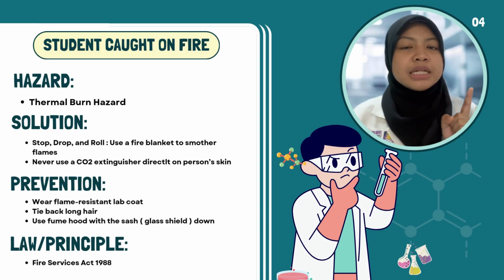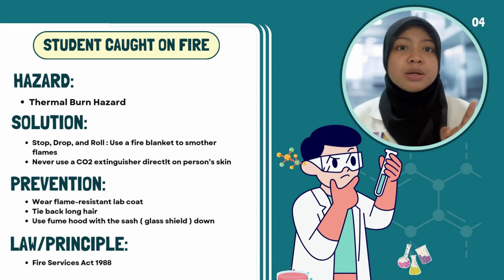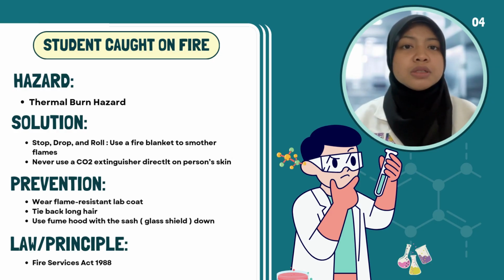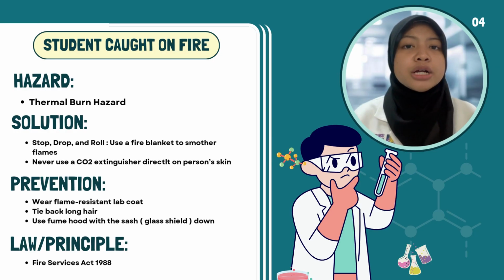The correct immediate action is stop, drop and roll to prevent the flames from spreading. A fire blanket should be used to smother the flames on the person. If available, the safety shower should be used immediately. A carbon dioxide fire extinguisher should not be used directly on a person's skin unless there is no other option.